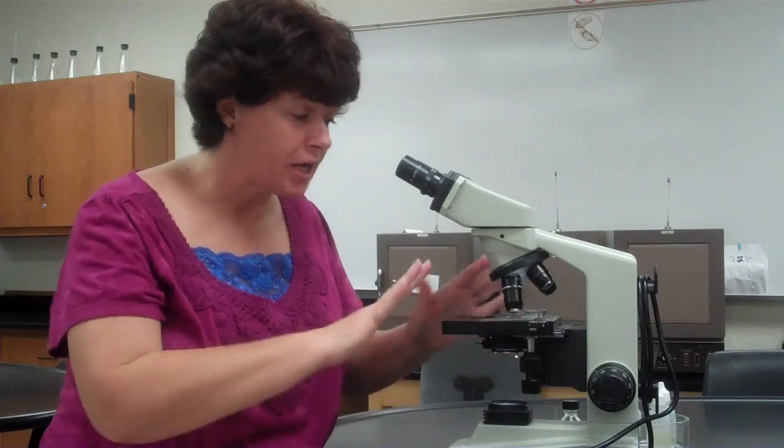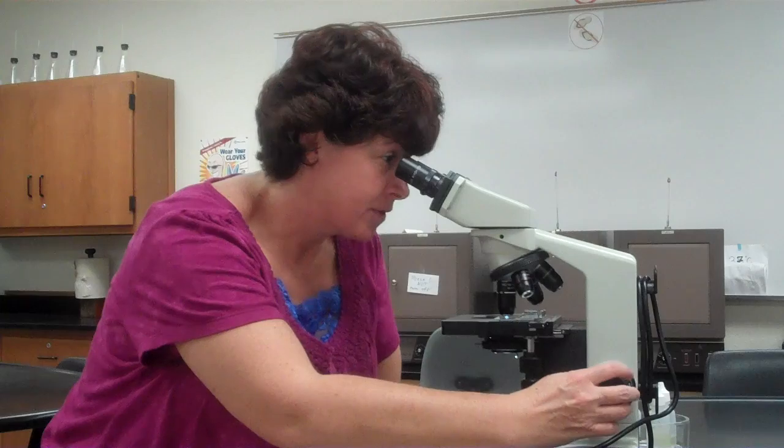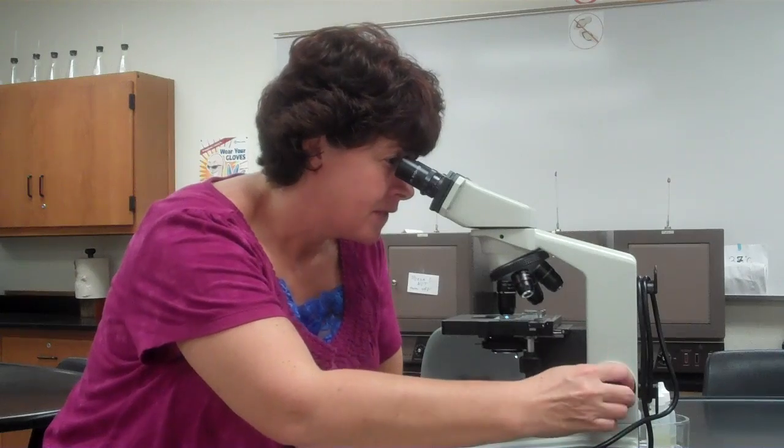Now that I have the oil on there, now I want to take a step back. Do you notice I did not move the stage? I did not move the slide. If you are focused with the 40, it will work with the 100. Make sure that it is absolute focus and it is centered on the slide before you put the oil on. It's kind of like the point of no return. So then I clip the 100 into place. So now I see it. It's a little bit blurry. Find focus. So I find focus and it comes right in.